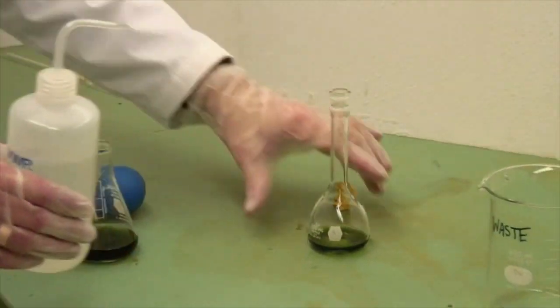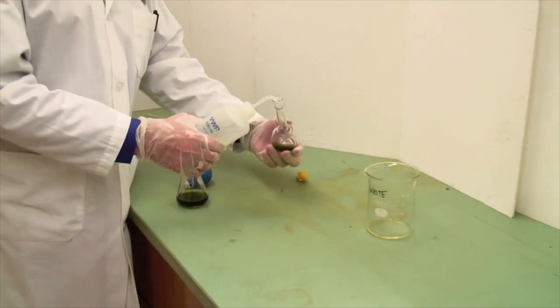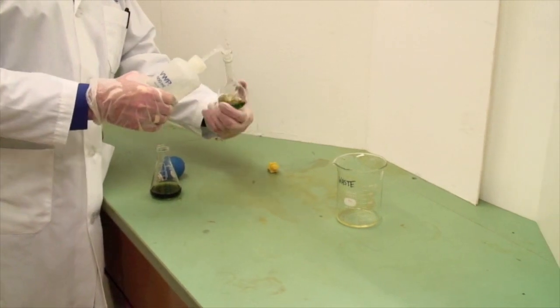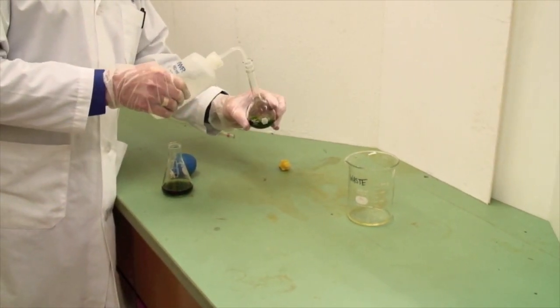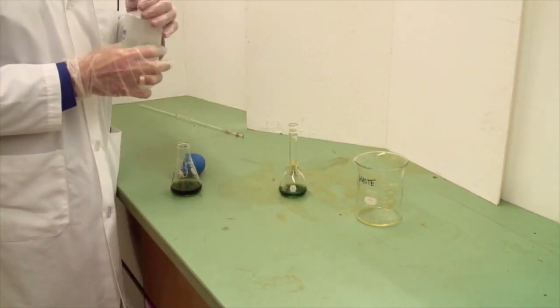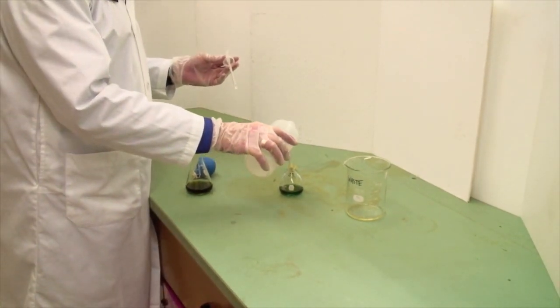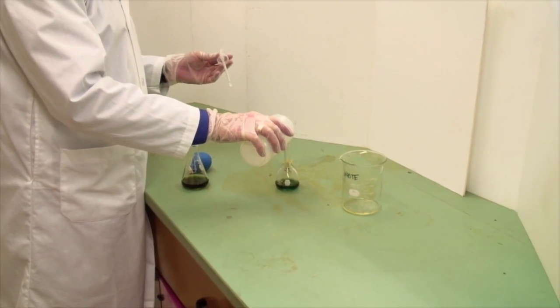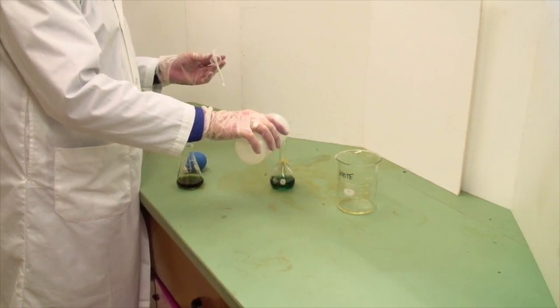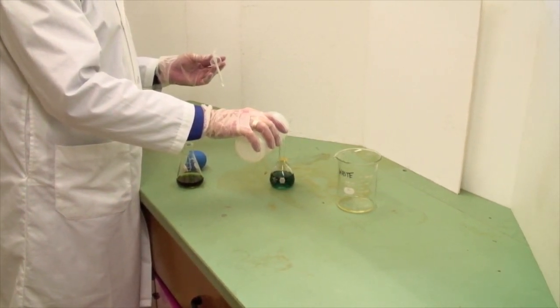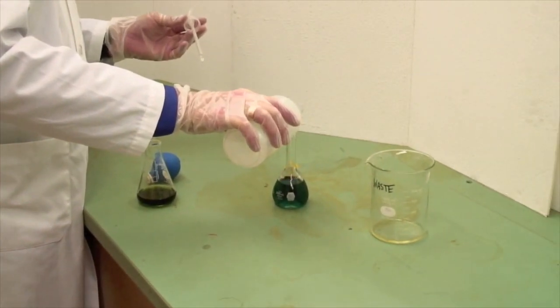Now at this point, use your distilled water bottle to wash down the sides. There is no point in squeezing 100 ml out there, so if you want to be quicker about it, just open the neck of your distilled water bottle and pour in until it's about two-thirds full like this.